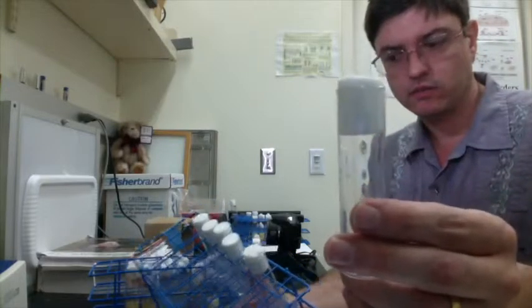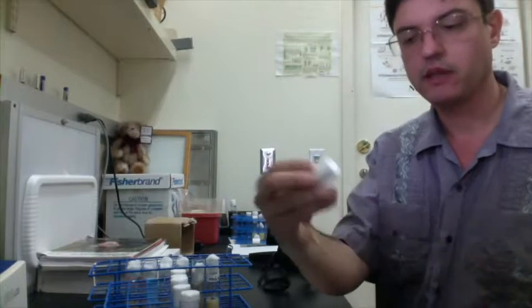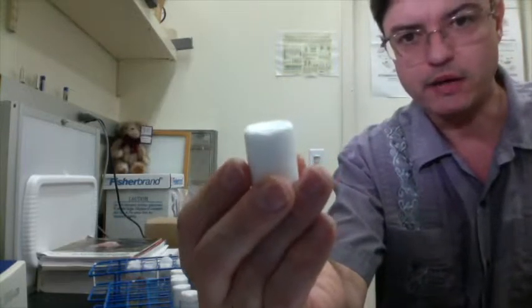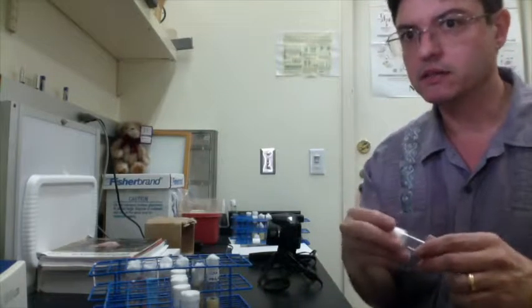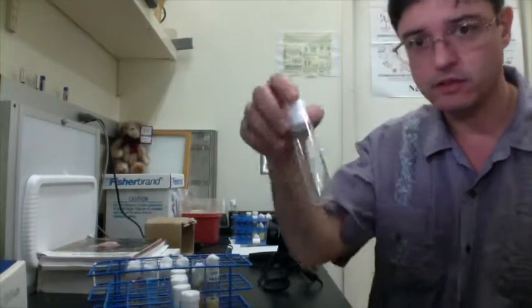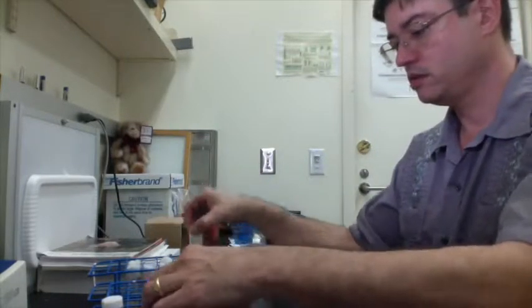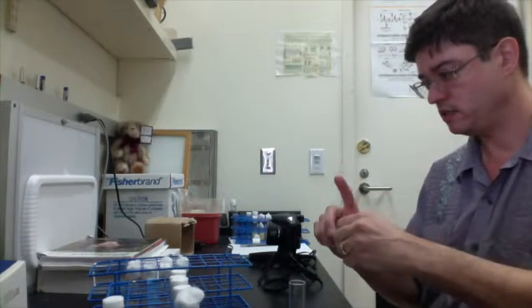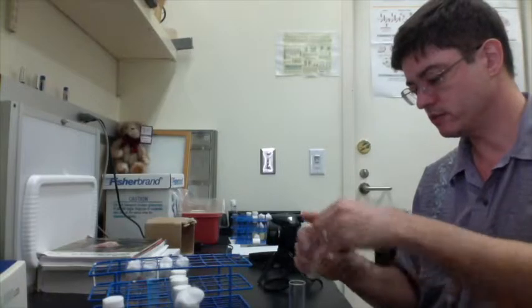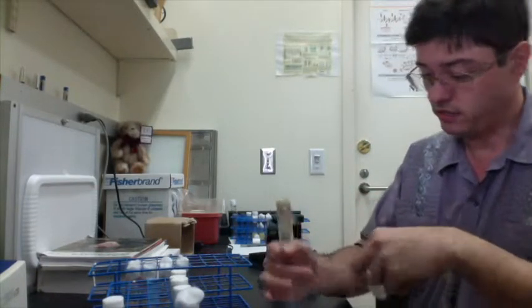You see here, this is one of the synthetic plugs that has a flat bottom, and it's sort of made out of foam. These are better than cotton because of the flat bottom, and the reason for that will become apparent pretty soon. Flies do not need to be anesthetized, so it's a much better way of comparing flies than if you had to anesthetize them.